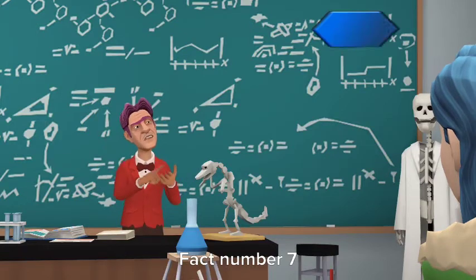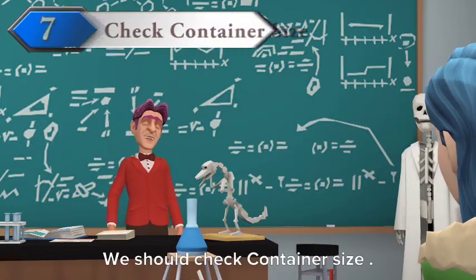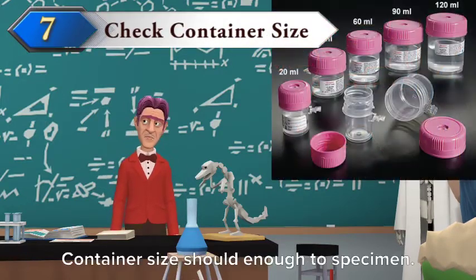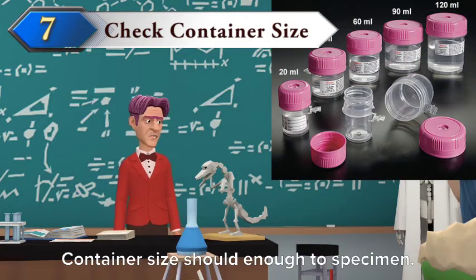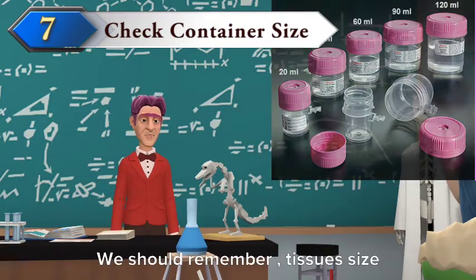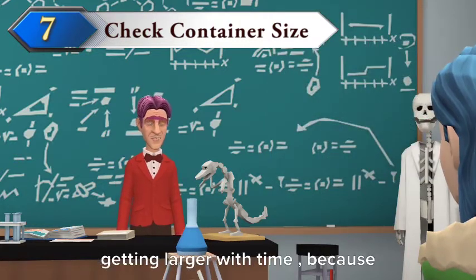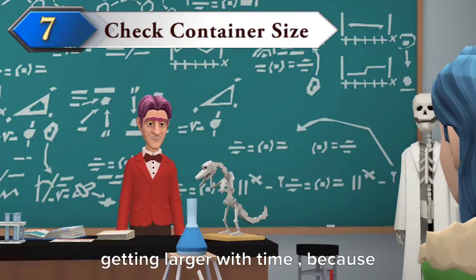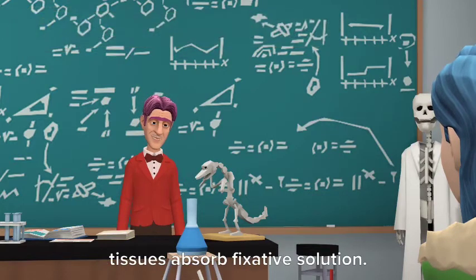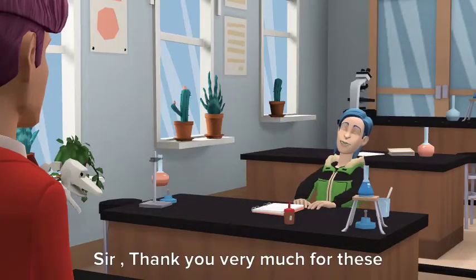Fact number 7: we should check container size. The container size should be sufficient for the specimen. We should remember that tissue size gets larger over time because tissues absorb the fixative solution.